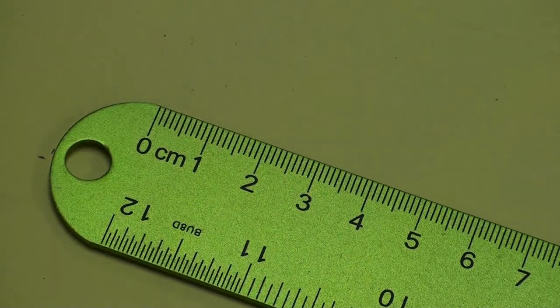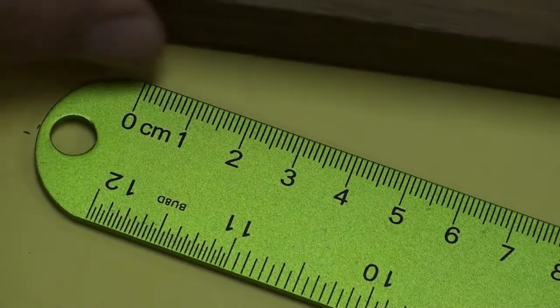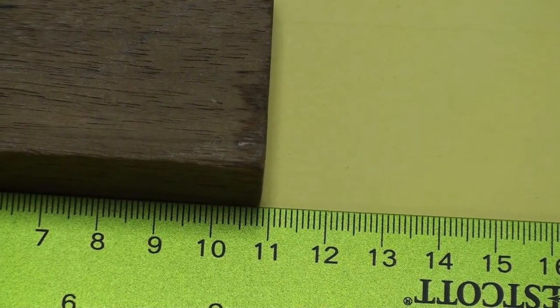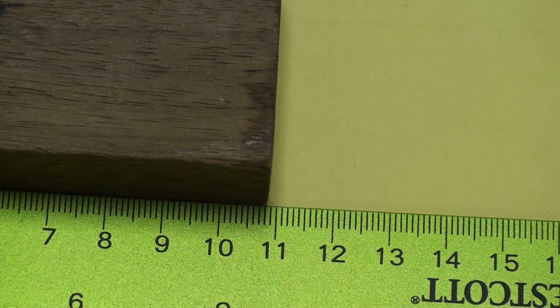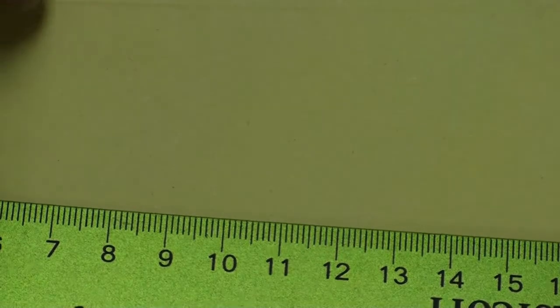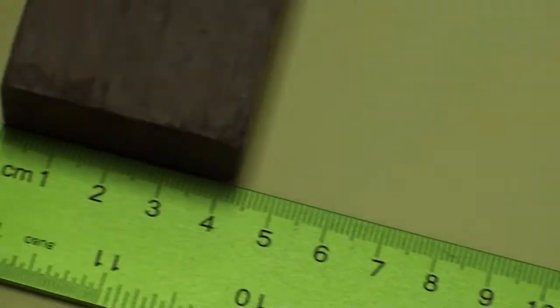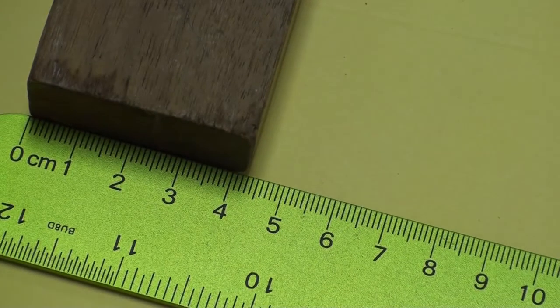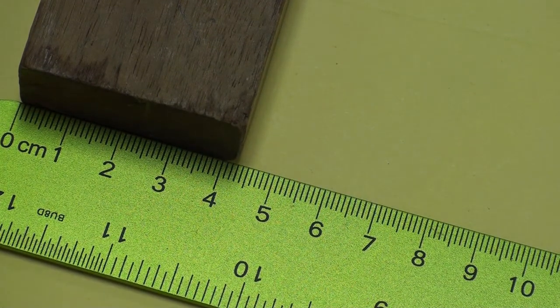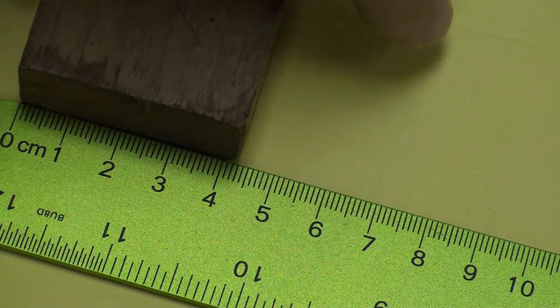Next, we're going to go with block M. Once again, we're going to start off with the length first. Lining it up with the 0 on one side. That's what we've got for the length. Block M, the length. Let's look at the width. Lining it up. And here we go with the width of block M. Take your best shot. It's a little hard to tell, but just take your best shot. Remember, you're measuring at least to the 10th place, at least to those lines.